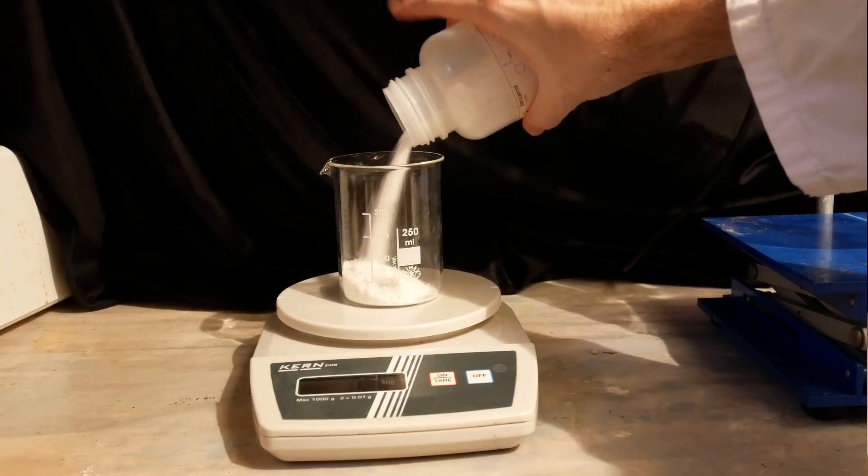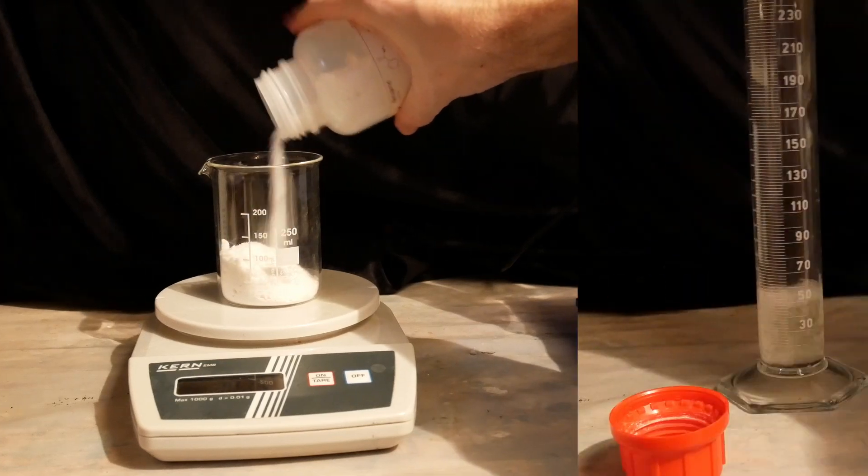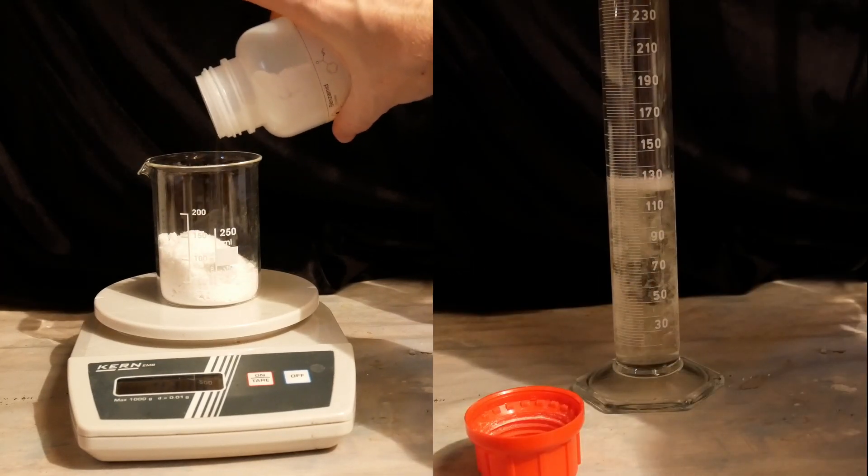To start the synthesis, we measure out 50 grams of benzamide and 200 mL of a 13% sodium hypochlorite solution.